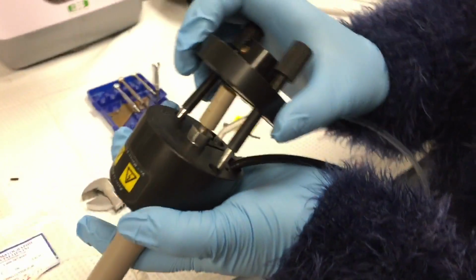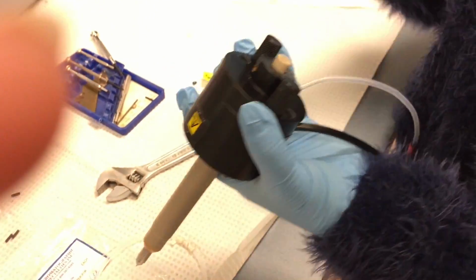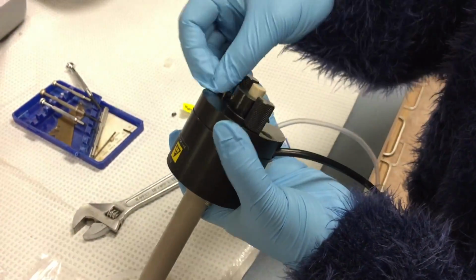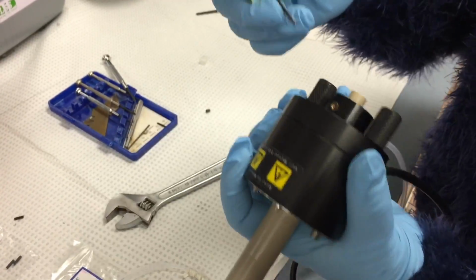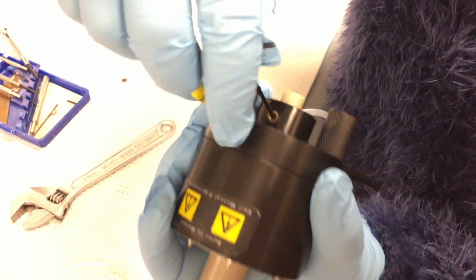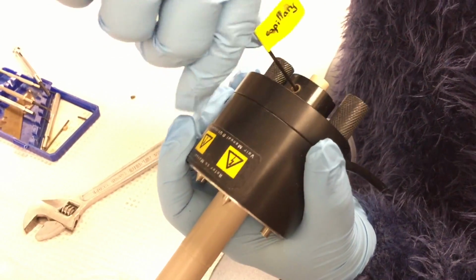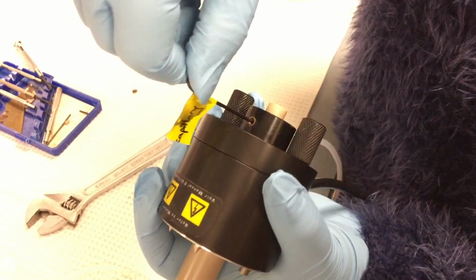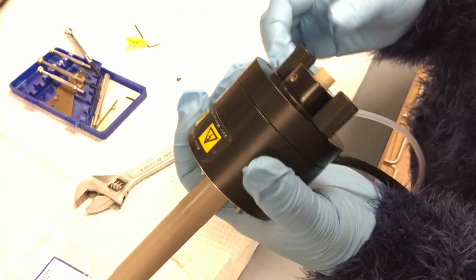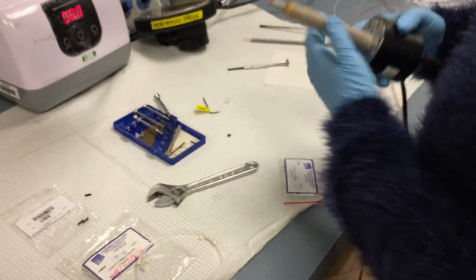Now we're going to attach this piece. Okay. Put the screws in the end. I'm going to tighten this set screw with an Allen key. So we'll tighten on the PEEK union, hold it in place. Just finger tight is good. Alright, now we have everything put back together in the probe.